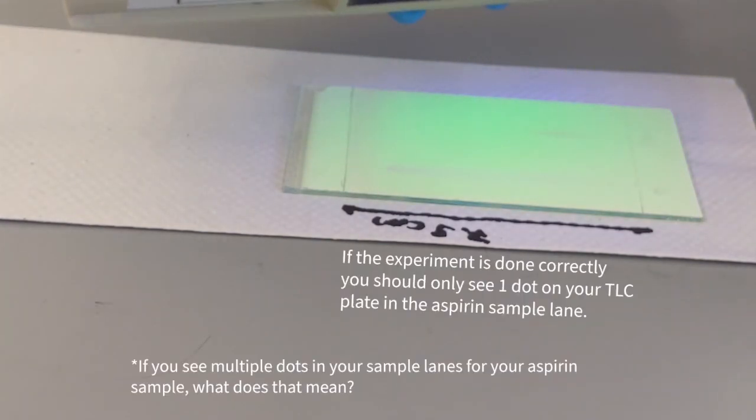You can go on to record the data from the TLC like we performed in the first TLC experiment under short UV light.